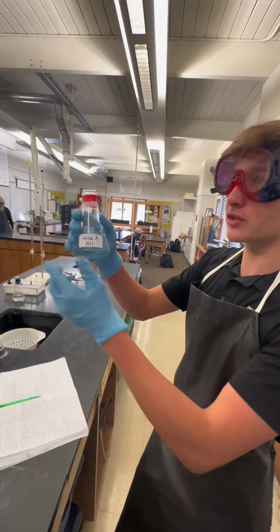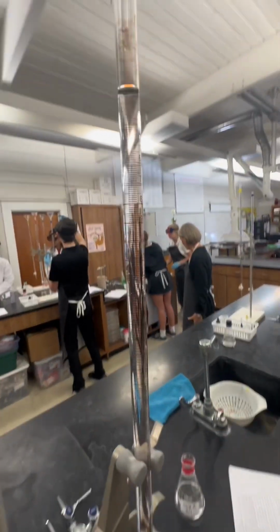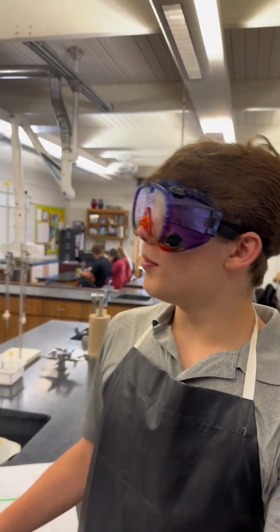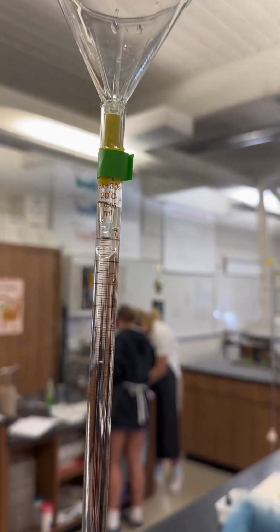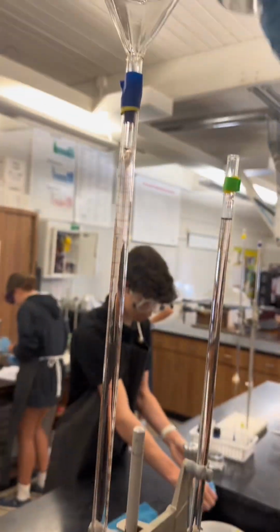So I am going to rinse this burette with acid A, also known as hydrochloric acid. This process will also be repeated 3 times. I will be filling up this acid burette with this acid to a little above this 0 milliliter mark. Now that that is said and done, I will let a little bit out to put it at the 0 mark and get rid of air bubbles in the tip. Boom. The bottom of the meniscus is at 0. And then we will repeat this process for the base as well.